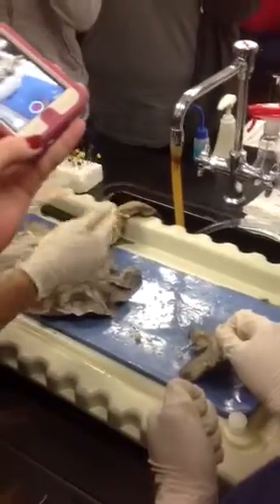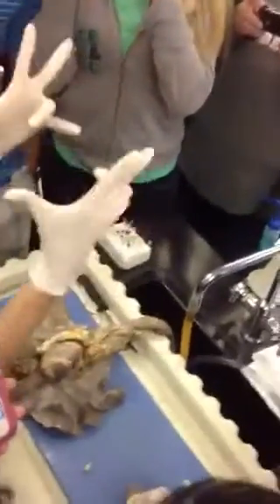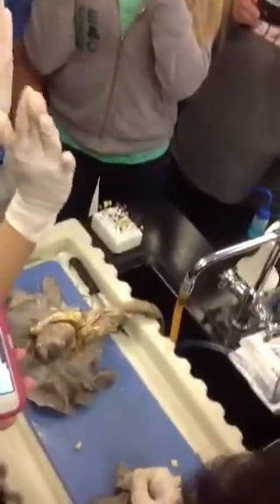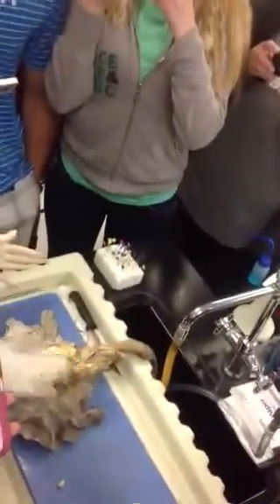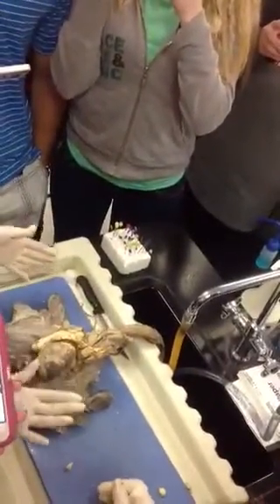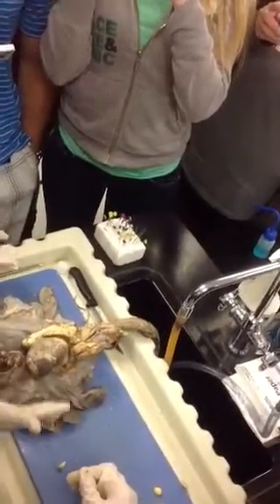So at this point, the sheep's head would be up here, obviously, because this is the trachea. And then its legs would be up in the air, right? So it's laying down with its legs up in the air. That means that this is the ventral side. So ventral can also be referred to as anterior.